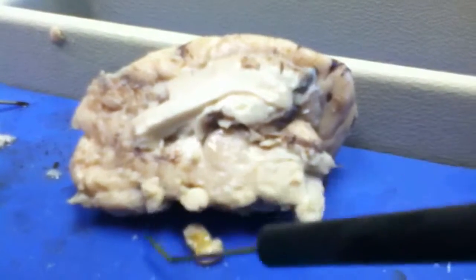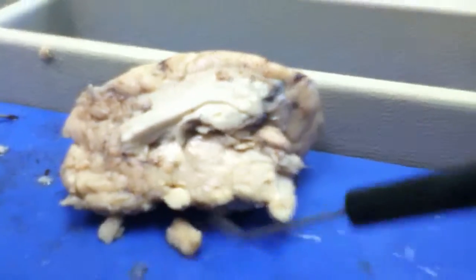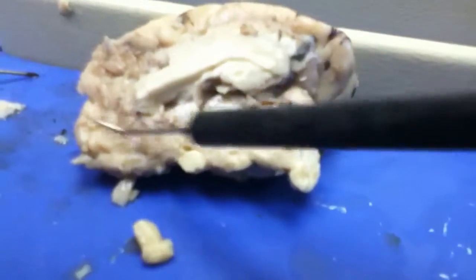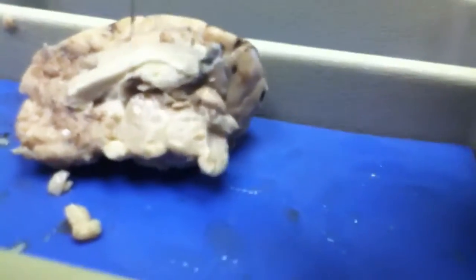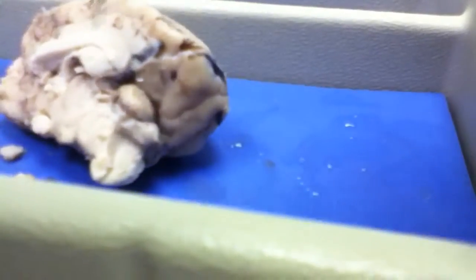The temporal has to do with hearing and your balance. And then the frontal is where you get your memory, your thought perception, your consciousness — all that kind of stuff. The wrinkles on the top are technically called convolutions.